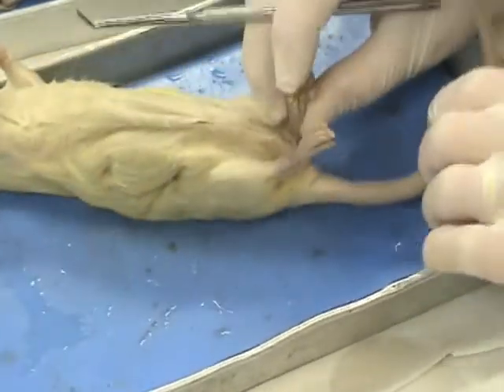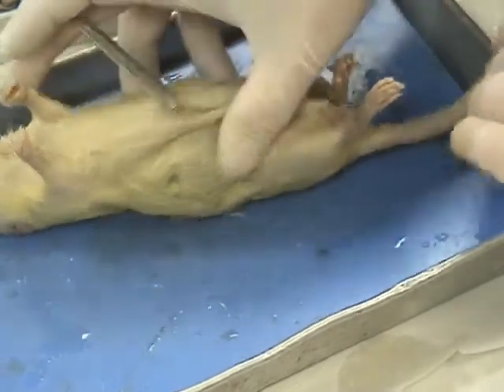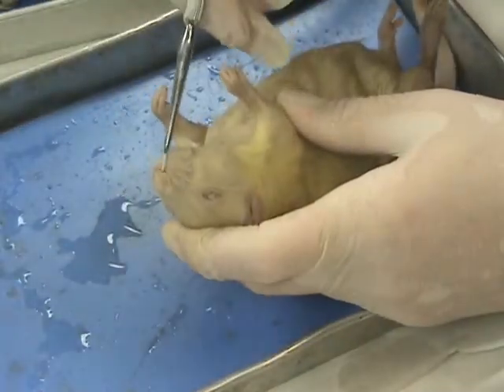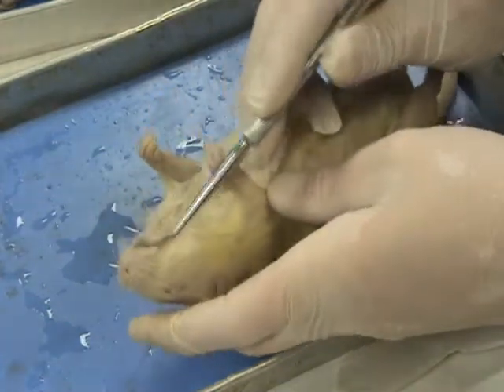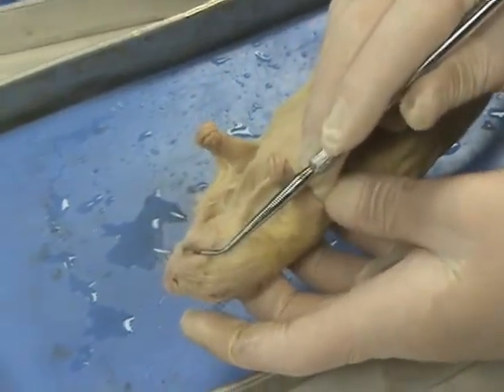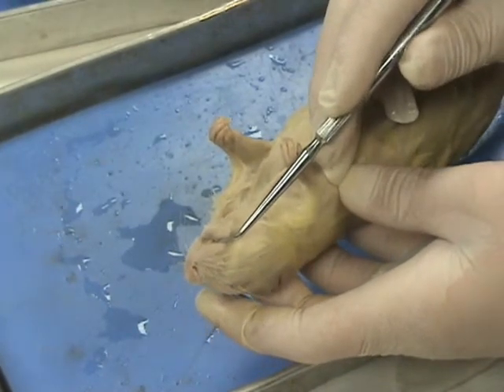Some other items that are identified on that sheet, we have legs and feet and tails, and I don't know if that's terribly hard to figure out, but some other terms, scientific terms for the nostrils. We've got the external nares. We also have the teeth, and you read in there about how the teeth are worn down. They keep growing during the lifetime of the rat, but as the rat feeds, that wears those teeth down.